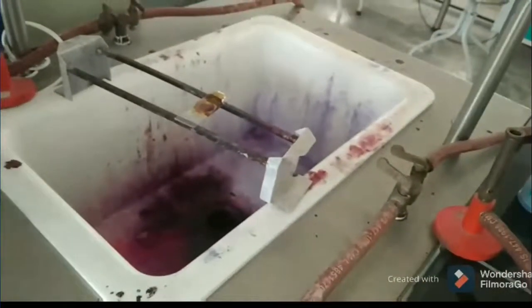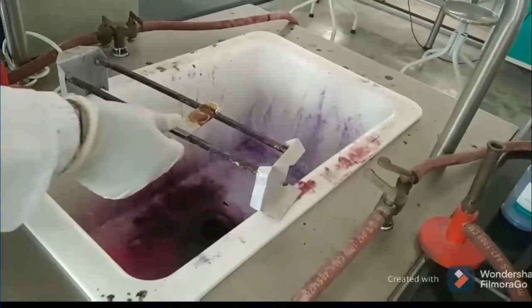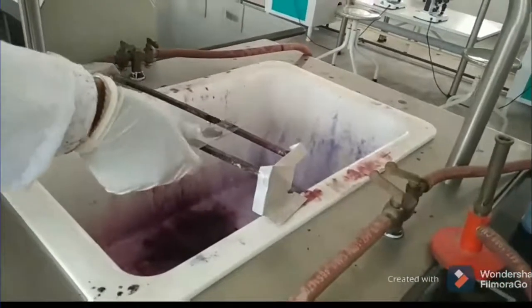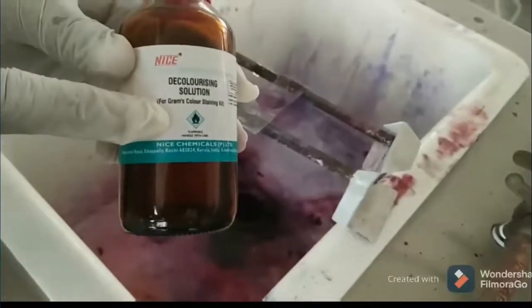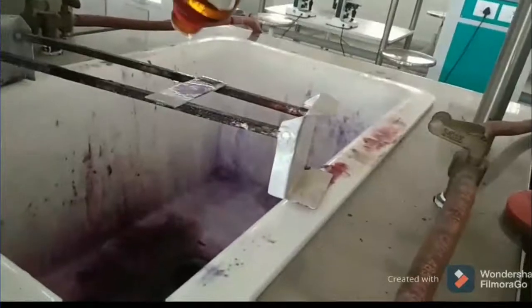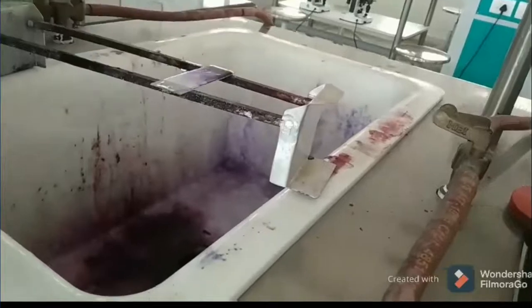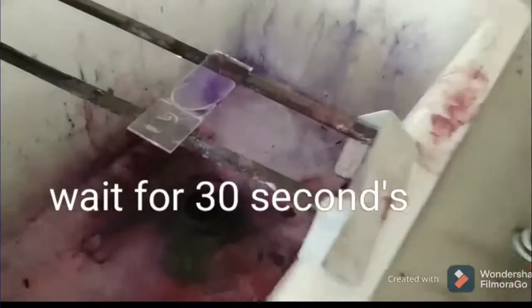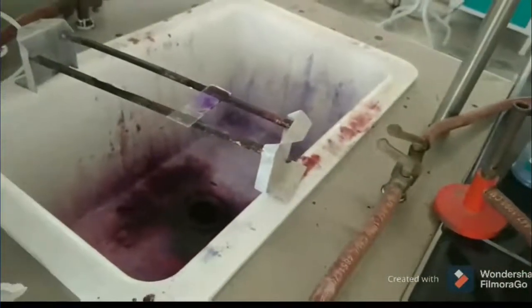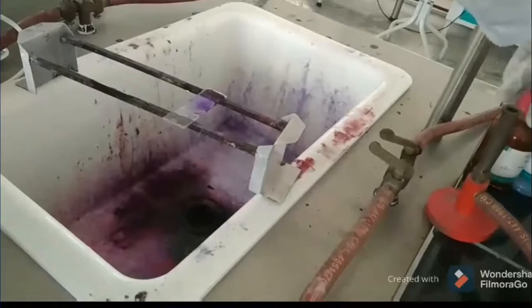The second step is gram's iodine, which acts as a mordant. Pour the gram's iodine so it covers the smear and wait for one minute. The gram's iodine forms a crystal violet-iodine complex, creating a bond that helps retain the stain. Then wash with distilled or tap water.